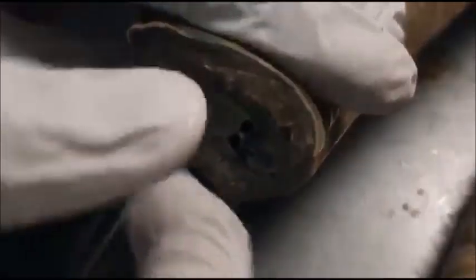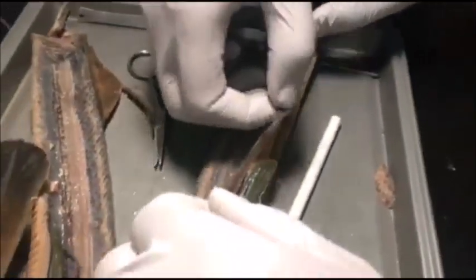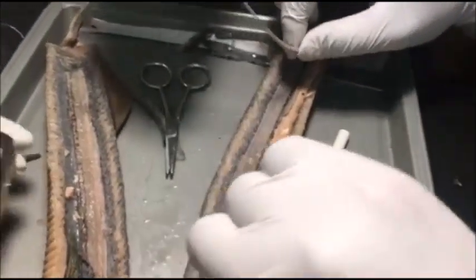Here we have what appears to be the gallbladder, along with the liver. We have also managed to pull out the intestines, which lead to the cloaca aperture — which is basically the genitals again.